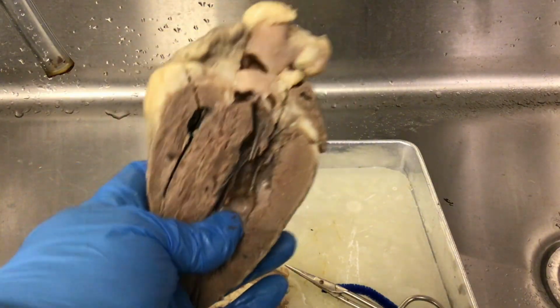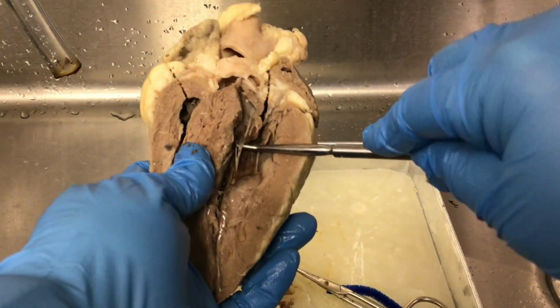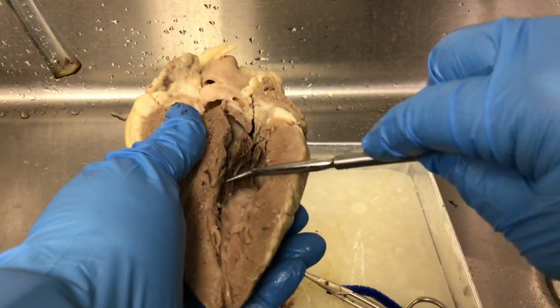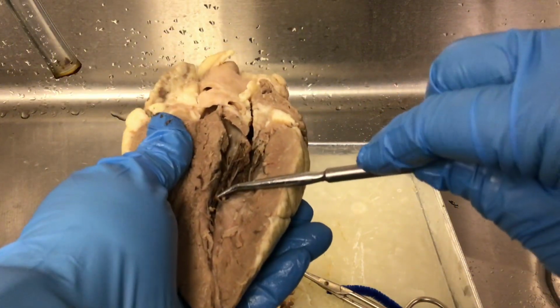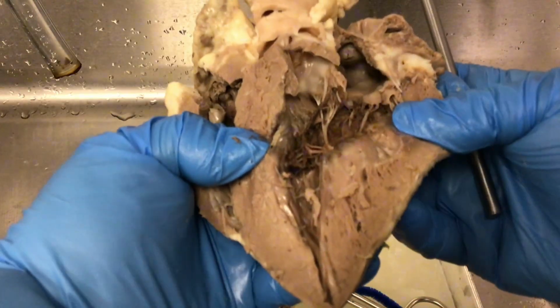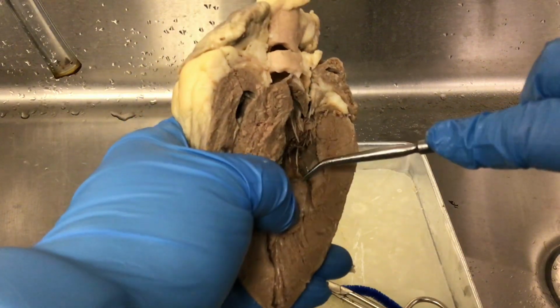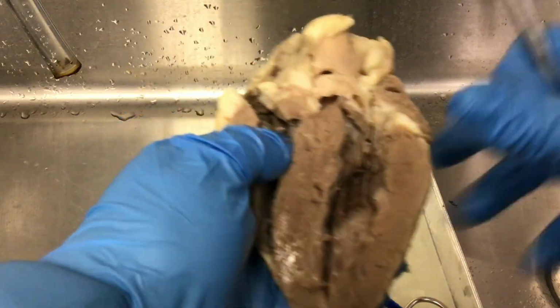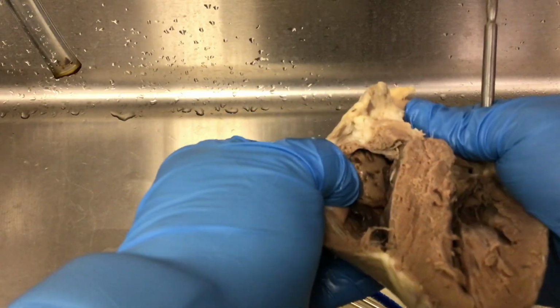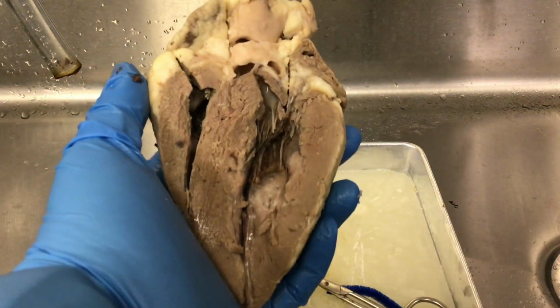All right, so that is it for the anatomy of the heart. Now, I will point out too, though, you can see the chordae tendineae really well, the bicuspid valve, and the chordae tendineae would be attached to papillary muscle in the ventricles. Also in the ventricles, you can see sort of the woven appearance of the wall of the ventricles. That's called the trabeculae carneae. And in the atria, you can see the muscle in the atria. Those are called pectinate muscles. All right, so that's going to be it for the dissected heart.